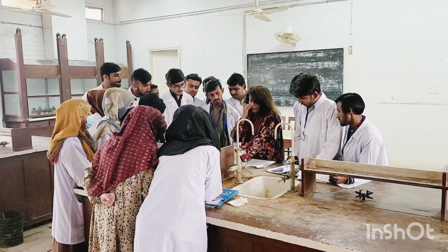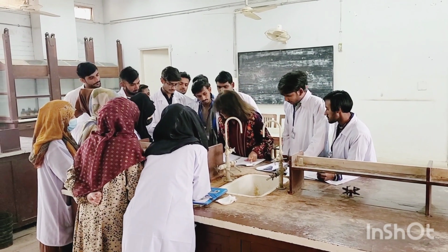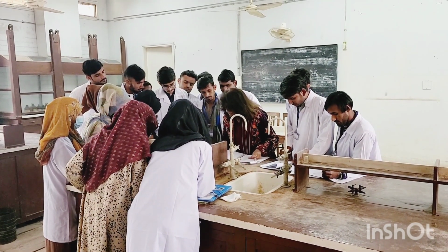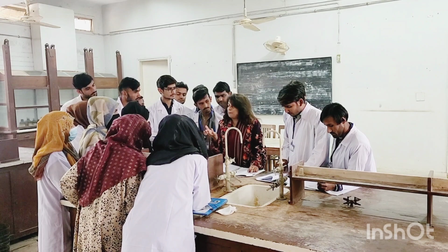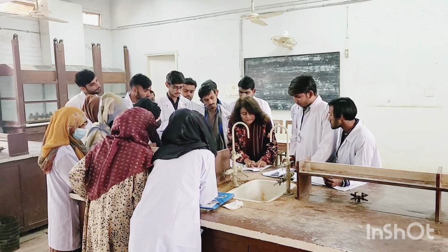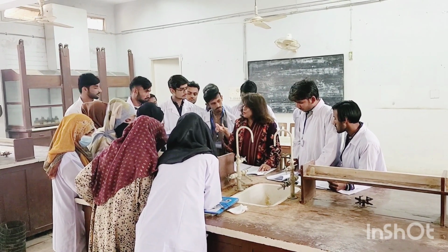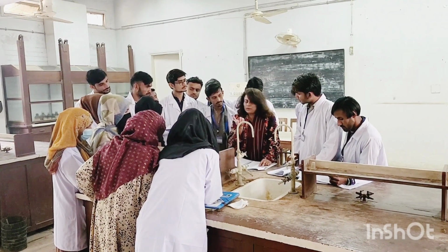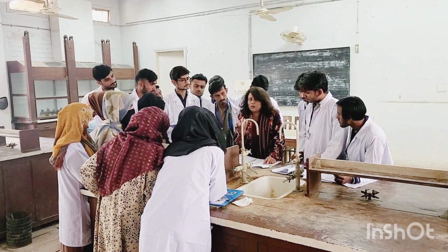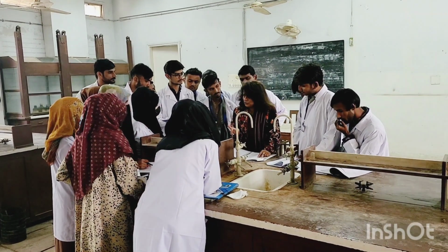So now, what is going to happen? After that, you will write out the physical state. Number one, physical state. Now, what does physical state mean? That is what type of compound it is, whether it is solid. They have given us the options in observations, whether it's a solid, liquid. If it's a solid, we will hand over your compound and you are going to look at it on the watch glass. You will have your compound, a known organic compound, right? And you will come to know whether it is white, whether it is solid or a liquid.